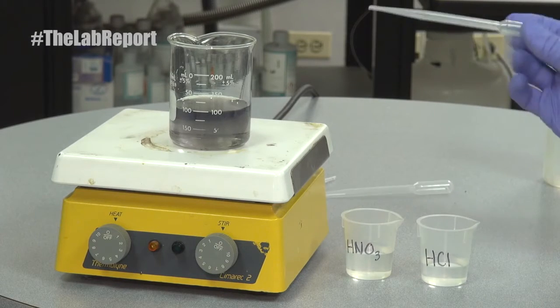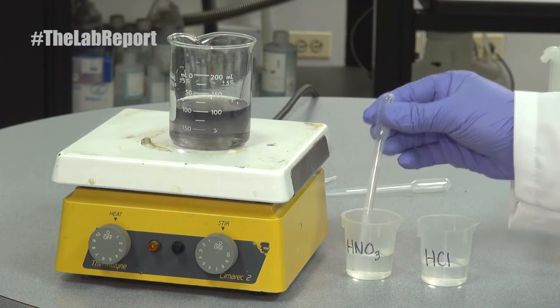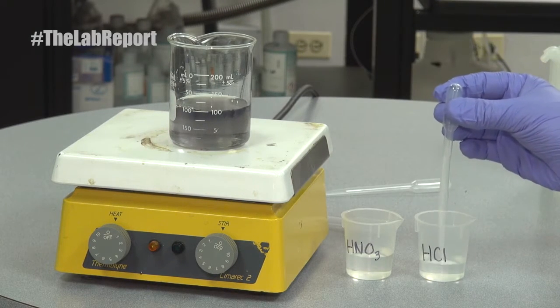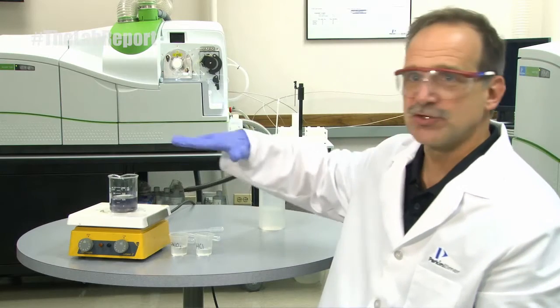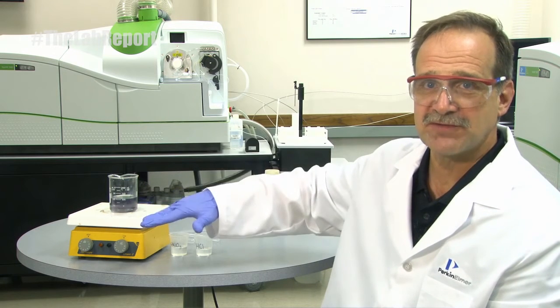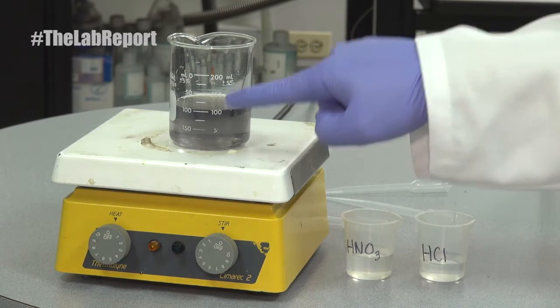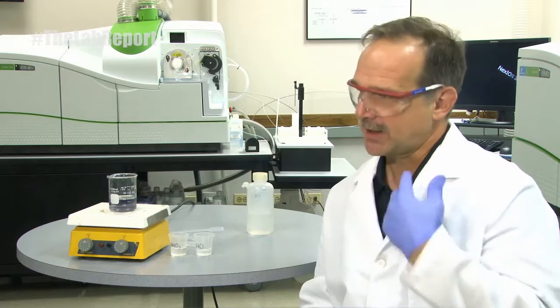Then you add a series of acids to the solution: you add five mils of nitric, two mils of concentrated HCl, and then you reduce the volume — once again not boiling, but reduce the volume down to approximately 20 mils. Cool the solution, bring it back up to 100 mils, and you're ready to run.